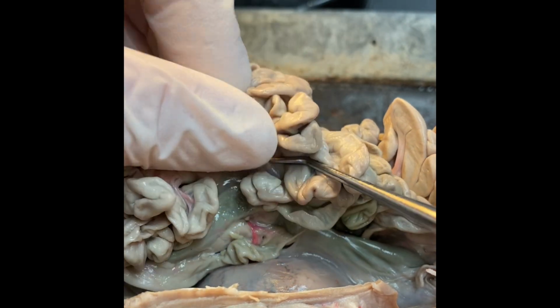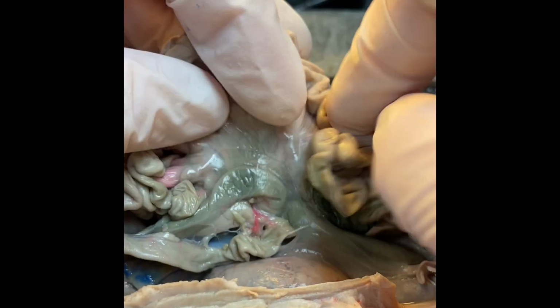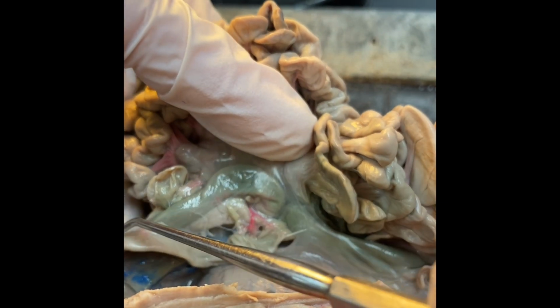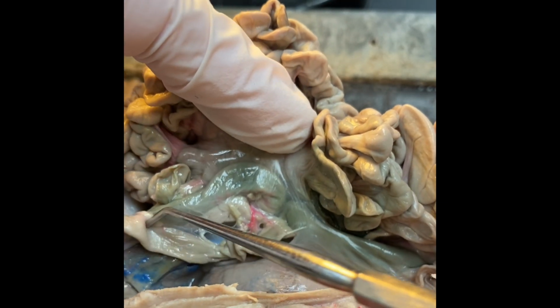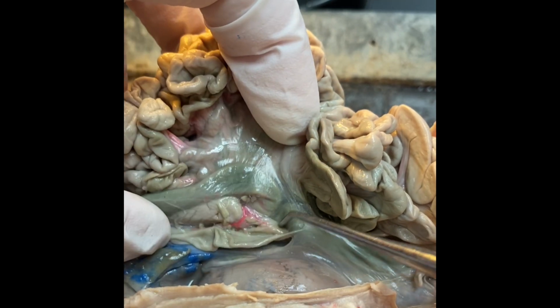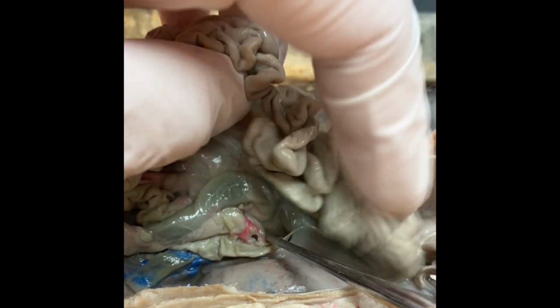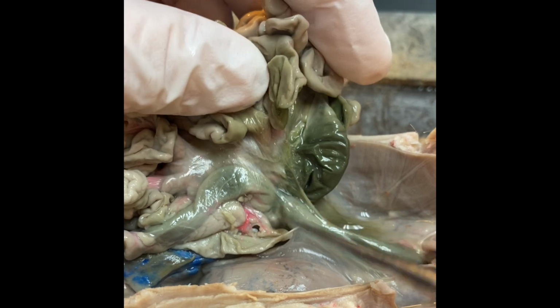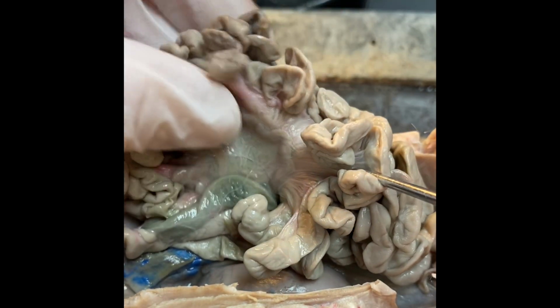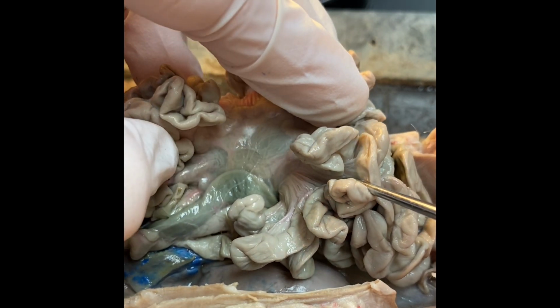Right. Now, as we keep going, you can see that I'm sort of walking along that mesentery. And to try to orient you, this is the duodenum, and it actually wraps underneath the large intestine and it pops back out on the other side. And we go through this whole network because the more surface area you have, the more digestion can actually happen.